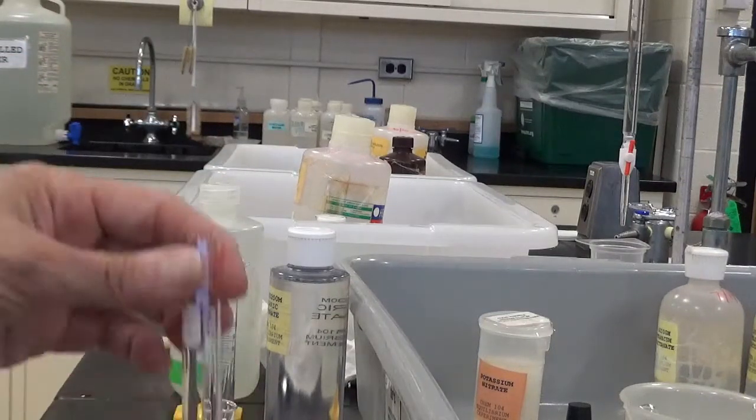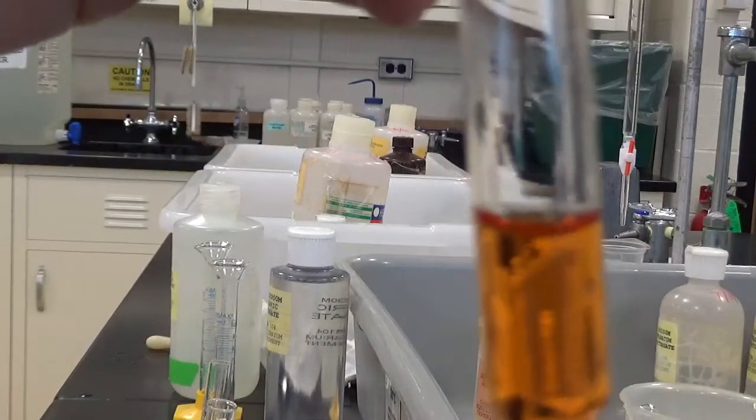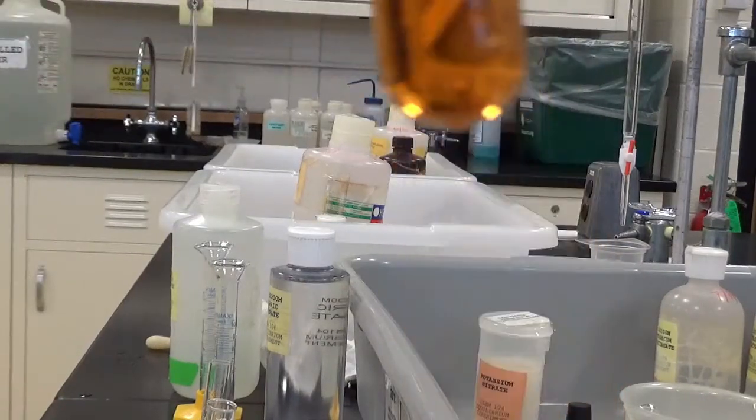Now for the fourth one, I'm simply going to add a few crystals of potassium nitrate. That's over here.